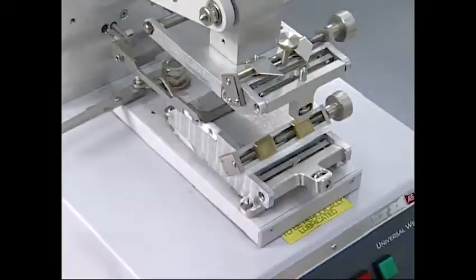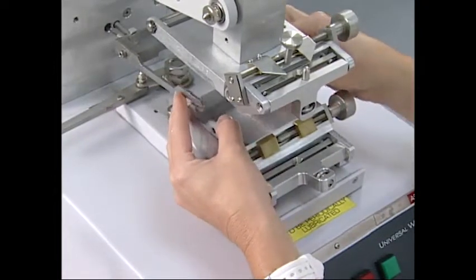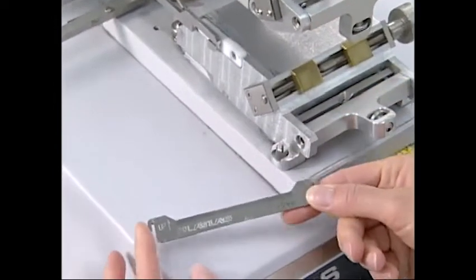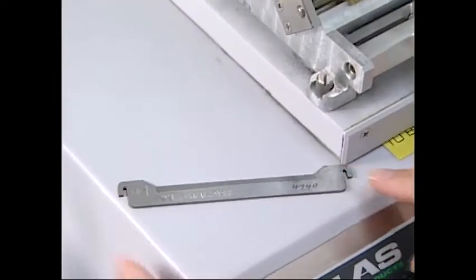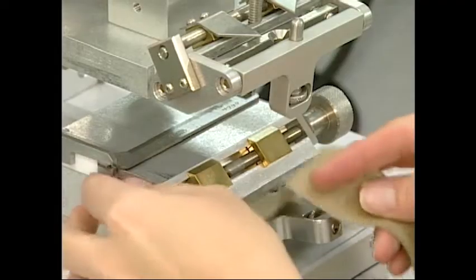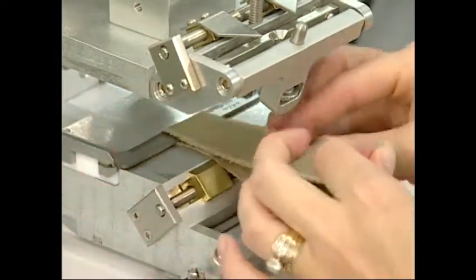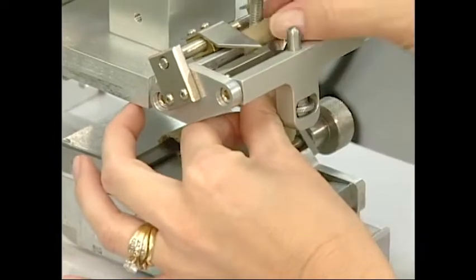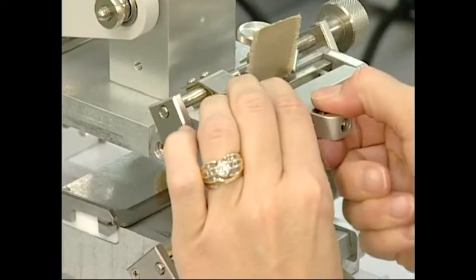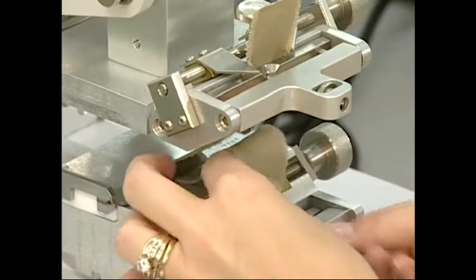The flex-abrasion test measures the durability of a substrate that is bent, flexed, or curved around an abradant bar. The flexing force used in this abrasion test is measured by subjecting the specimen to a unidirectional and reciprocating folding around the standardized bar. The conditions of pressure, tension, and abrasive action are precisely specified.